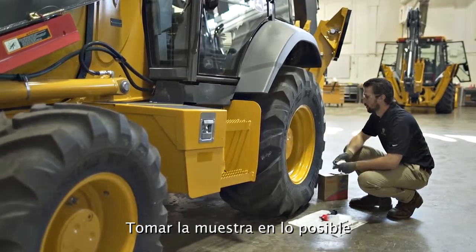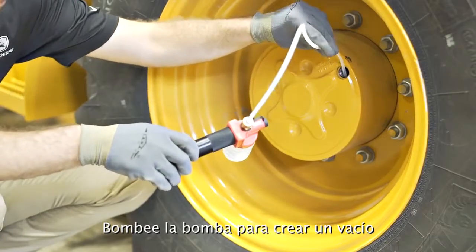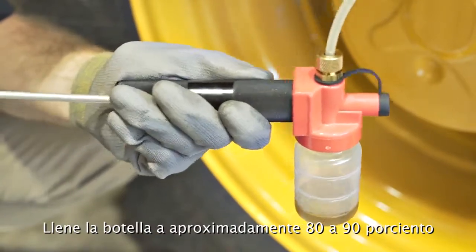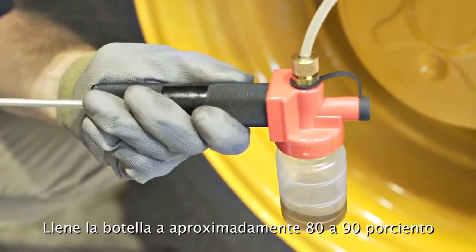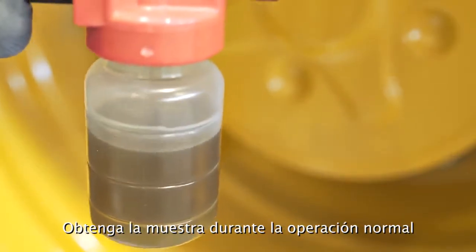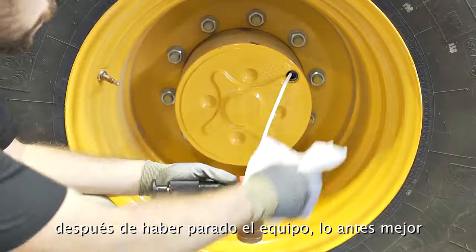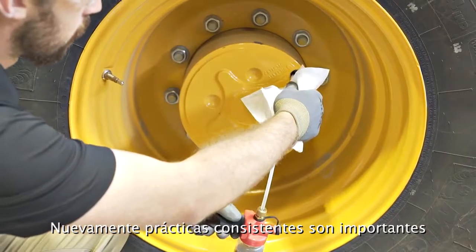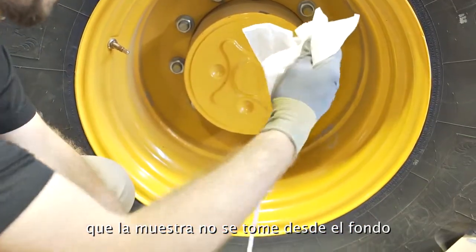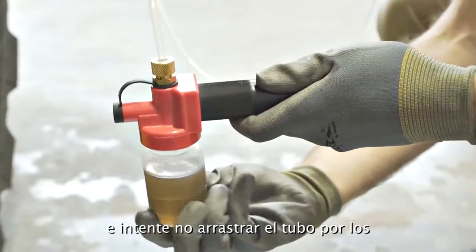Clean the area before opening the reservoir access. Sample from the inlet side of the reservoir if possible and always sample from the same fluid level. Pump the vacuum pump handle to create a vacuum. Hold the pump upright to avoid oil from contaminating the pump. Fill the oil sample bottle approximately 80 to 90 percent full. Leave some air space between the top of the fluid and the top of the bottle. Obtain samples during normal equipment operation or within 30 minutes after equipment is shut down — the sooner the better. Again, consistent practices are important. When sampling from a reservoir, make sure that the sample is not obtained from the bottom of the oil compartment where contaminants accumulate, and avoid scraping the tubing along the sides of the tank or reservoir.